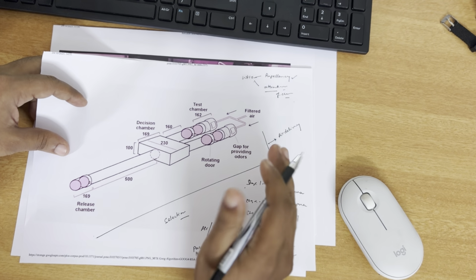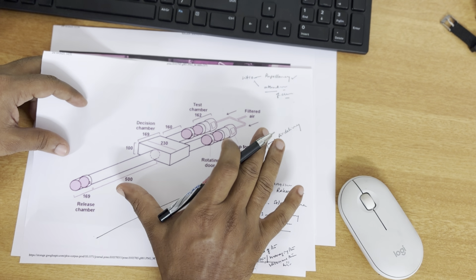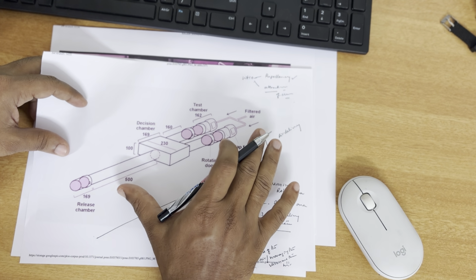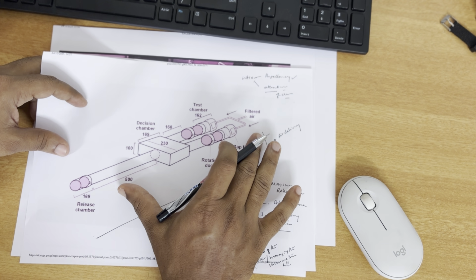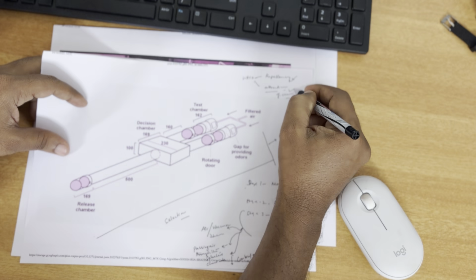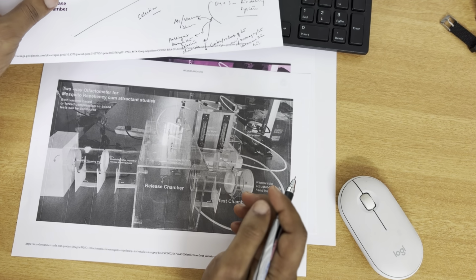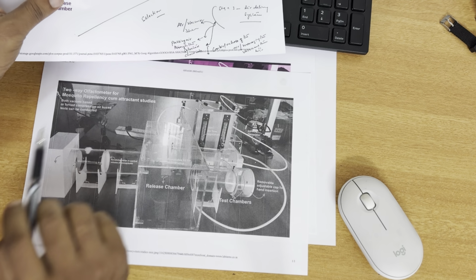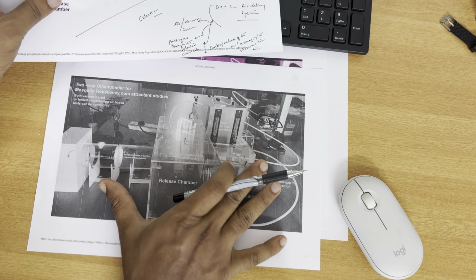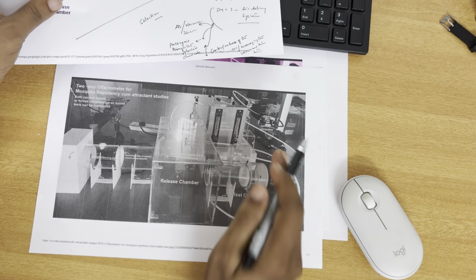Now I'm going to explain how the whole olfactometer setup looks, how many stages it is divided into, and how it can be used both for repellence effect studies as well as attraction studies. Now I'm going to show you how an install two-way olfactometer looks. The two-way olfactometer looks like this. I'm going to identify the components as well as the number of stages.